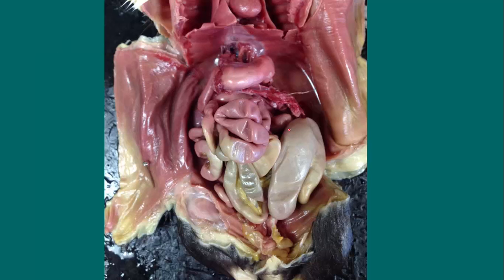So this is a close-up view of the abdominal cavity with the digestive structures, and what I did was I removed the liver. The liver was actually covering over the stomach. So you can see in this picture, here's the diaphragm. Remember, that separates the thoracic from the abdominal cavity. Right here is the esophagus. So the esophagus comes down and goes into the stomach. This is the stomach right here. And then the stomach leads again to the small intestines that wind their way around. It's hard to see the large intestine in this picture because it's all back behind.